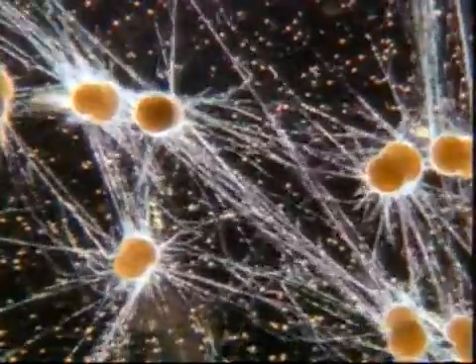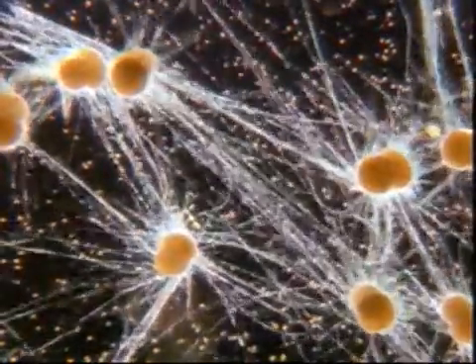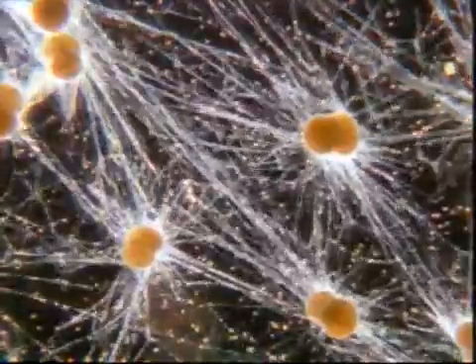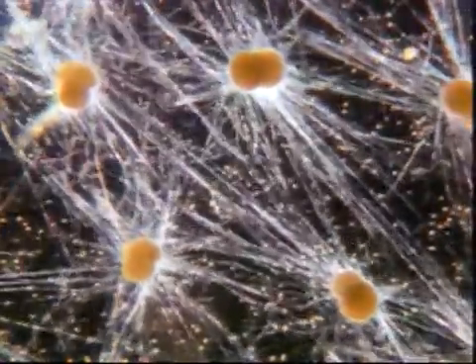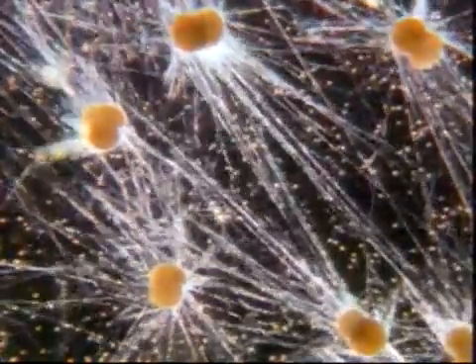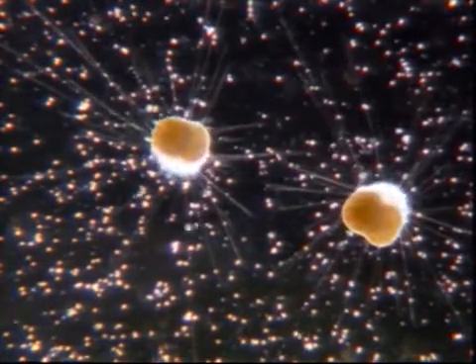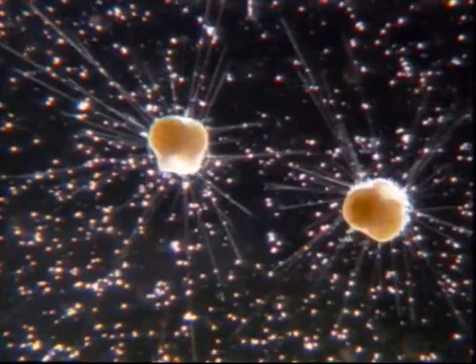A detail from a protoplasmic network which transports juveniles. Probably most of the protoplasmic filaments are residual protoplasm deriving from the multiple fission. Upon termination of the transport, this protoplasm forms a coat with radiating processes around the two-chambered daughter cells.